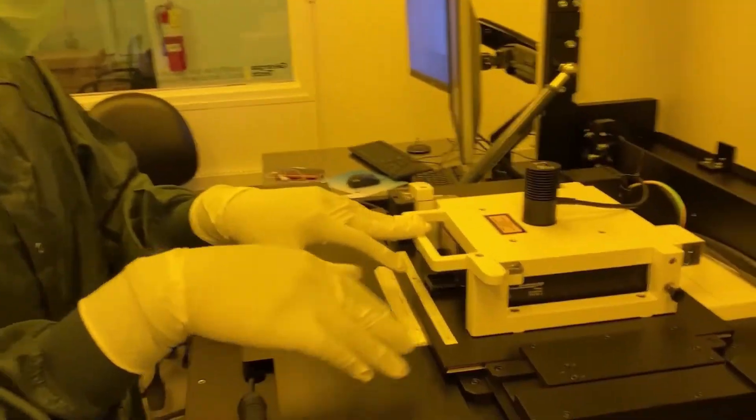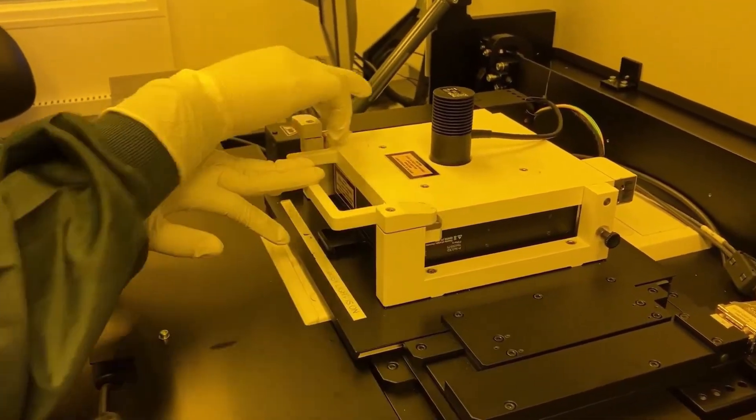Once your sample is in, carefully lower the stage and then push the tabs back over the lid to secure it.